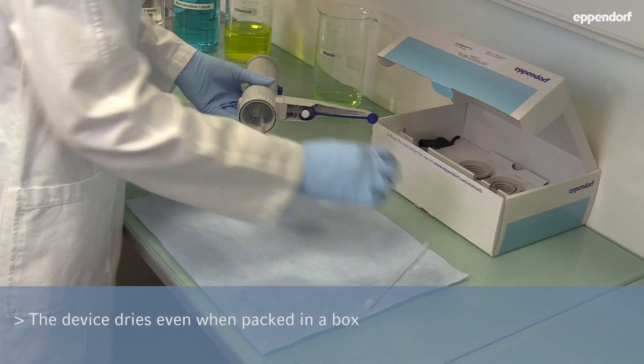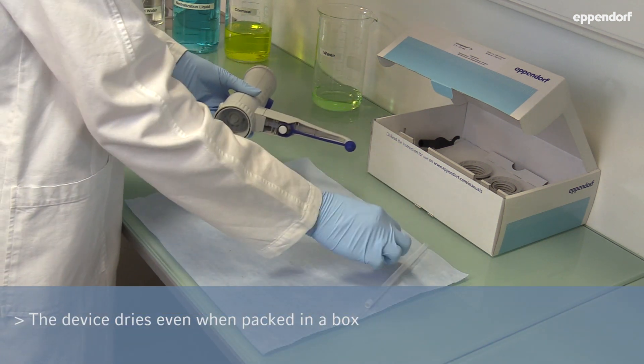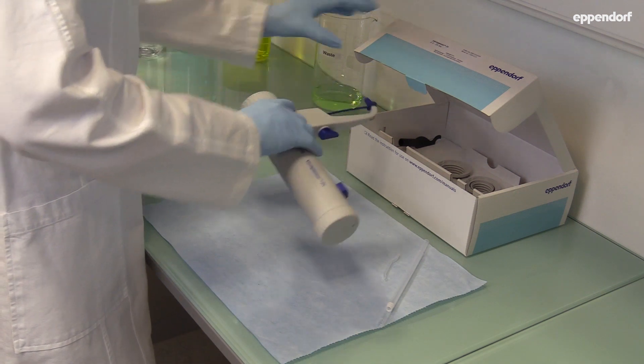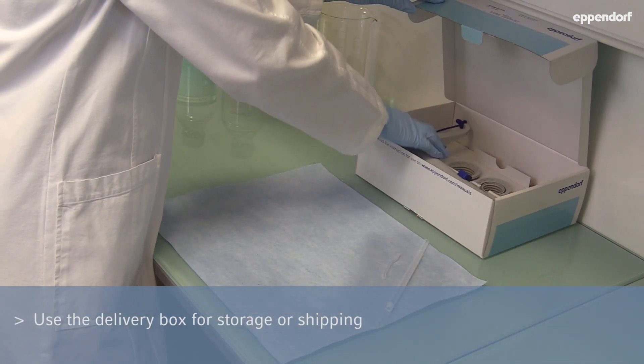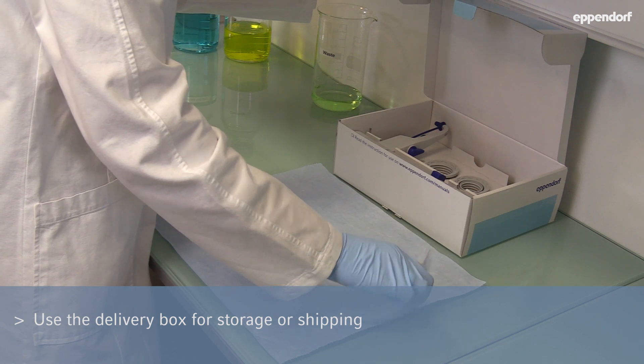The mixture will dry fast, even if the device is packed in a box. Now, your bottletop dispenser is clean and ready for shipping or long-term storage.